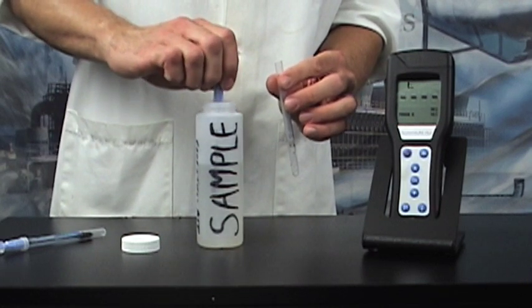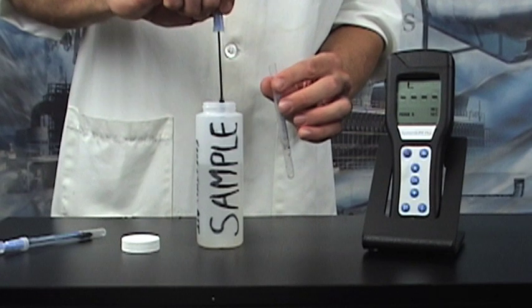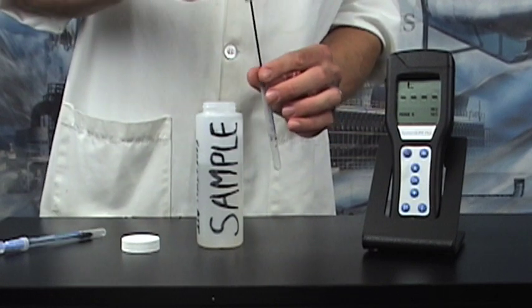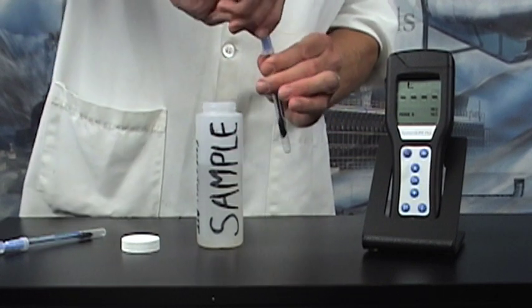Make sure not to touch the sides of the sample container. Insert sample collector back into protective covering.